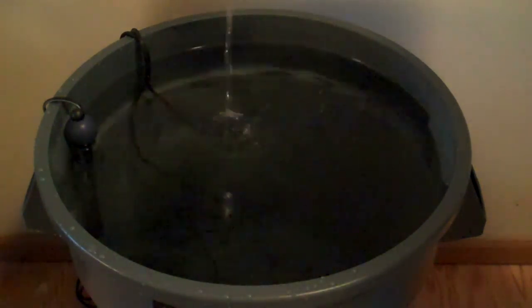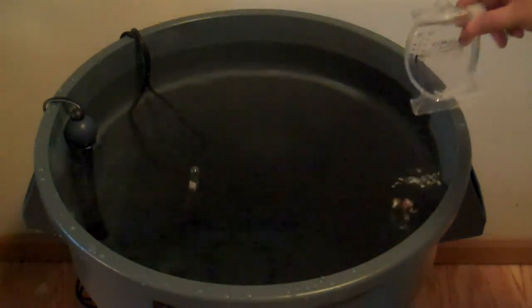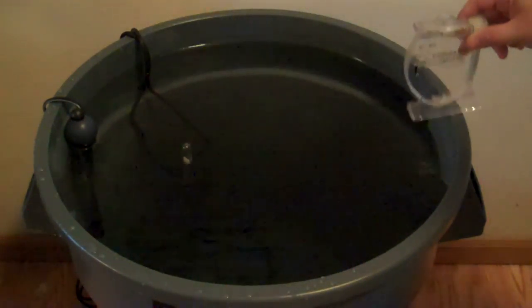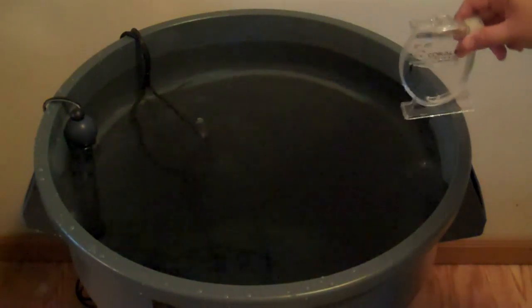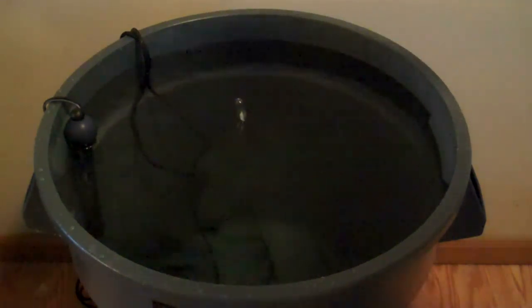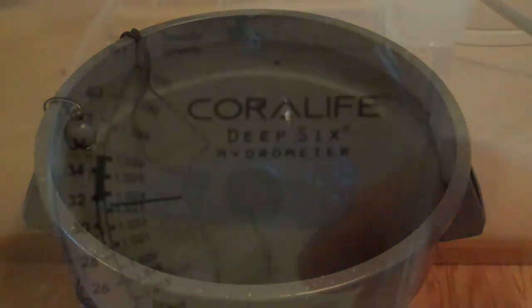You have to get all the bubbles out. Make sure there's no bubbles there. We tap it. Now we're going to get it to a level surface and get a reading.